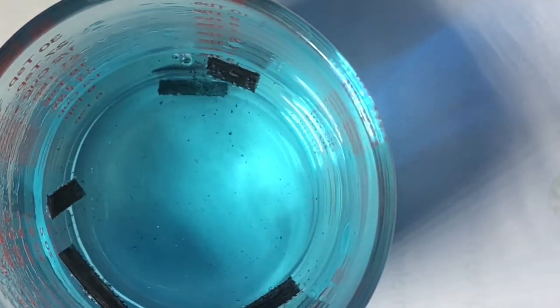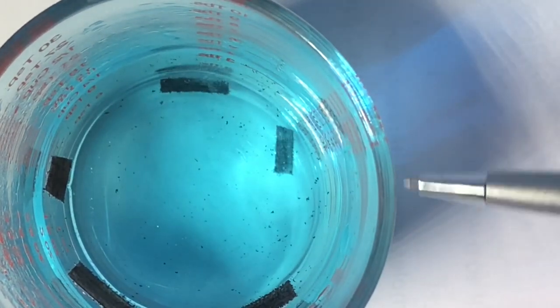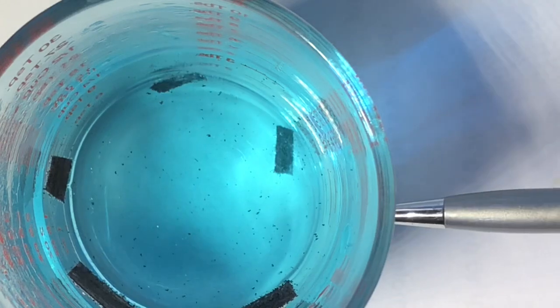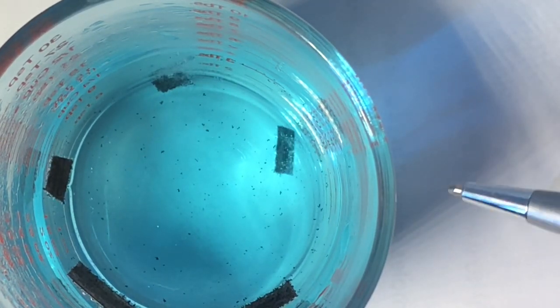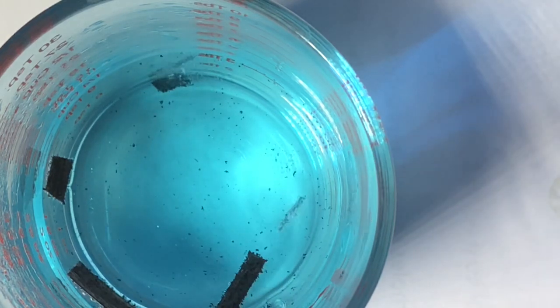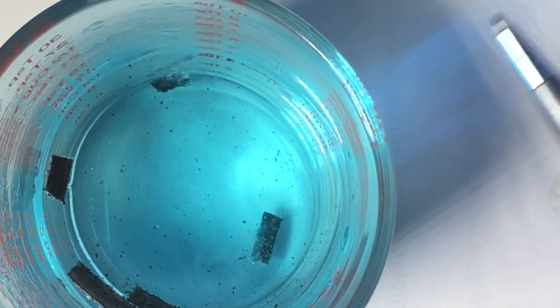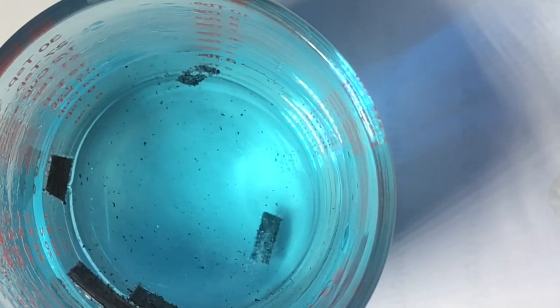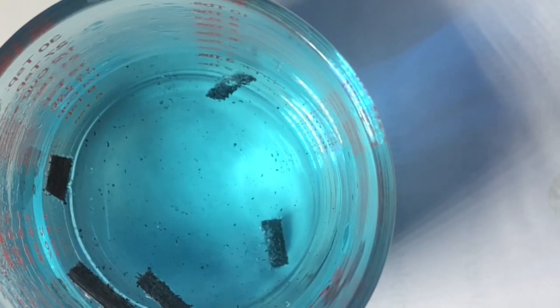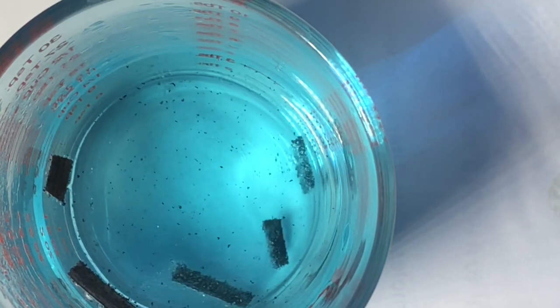Starting to, might be able to see the small particles floating around, these little black and brown things swinging by. Those are chunks of copper that are forming and then breaking free of the pieces of magnesium. The magnesium is rising and falling because it's also undergoing some oxidation of water. It's producing hydrogen gas there. All right, so we'll let that go for a little bit.